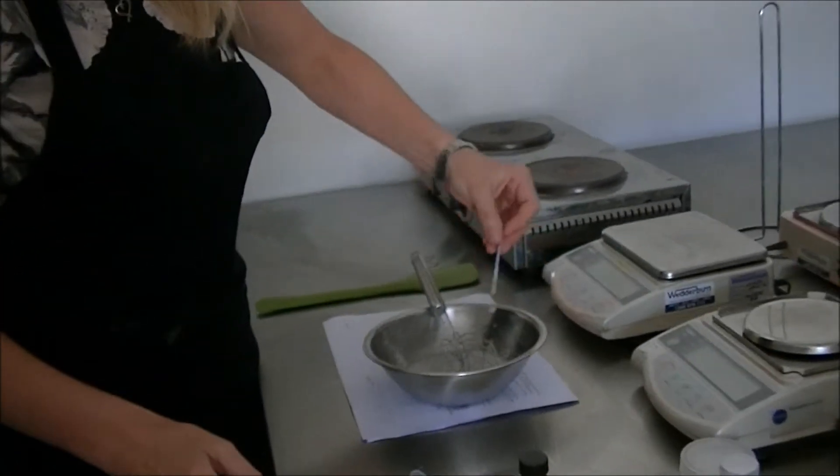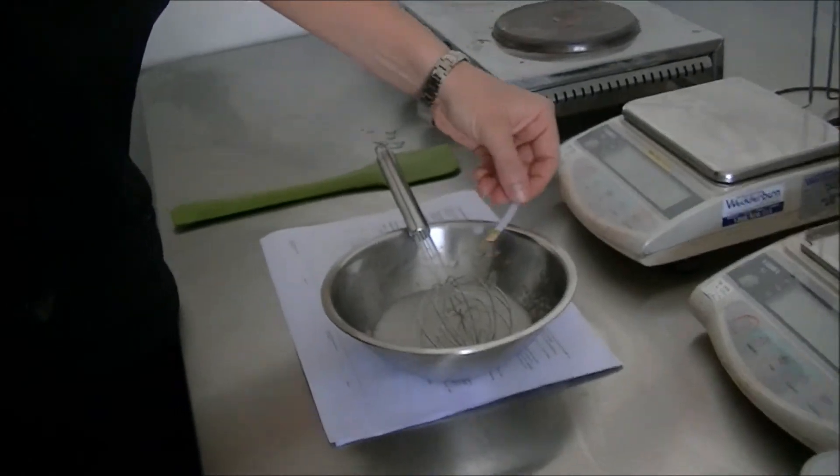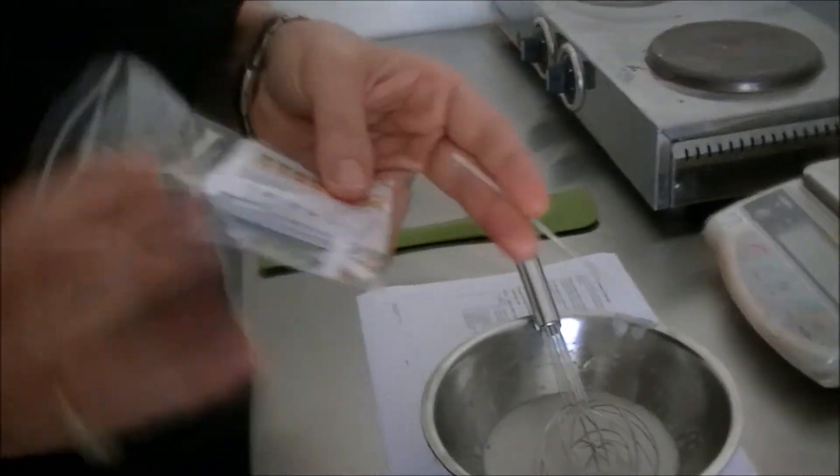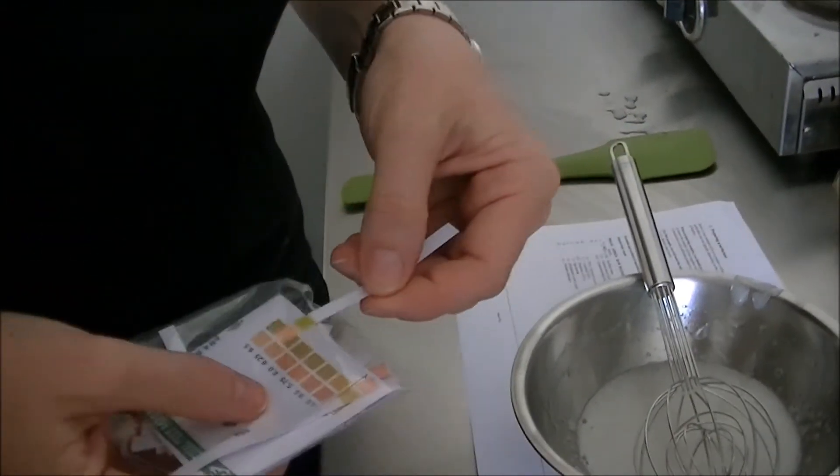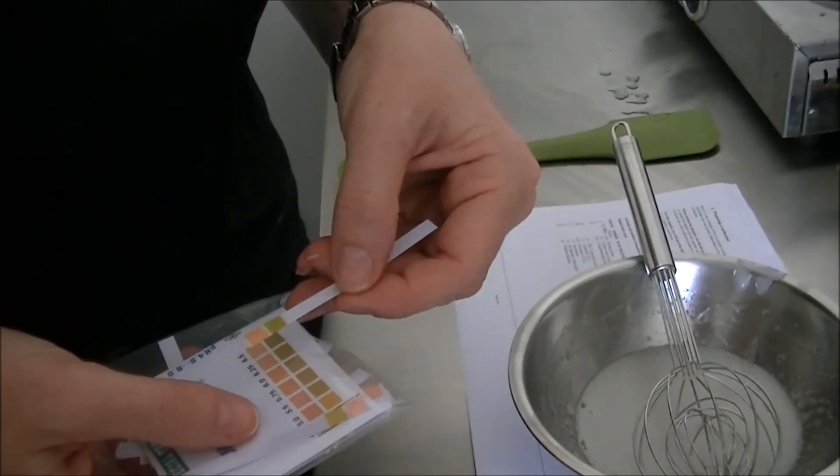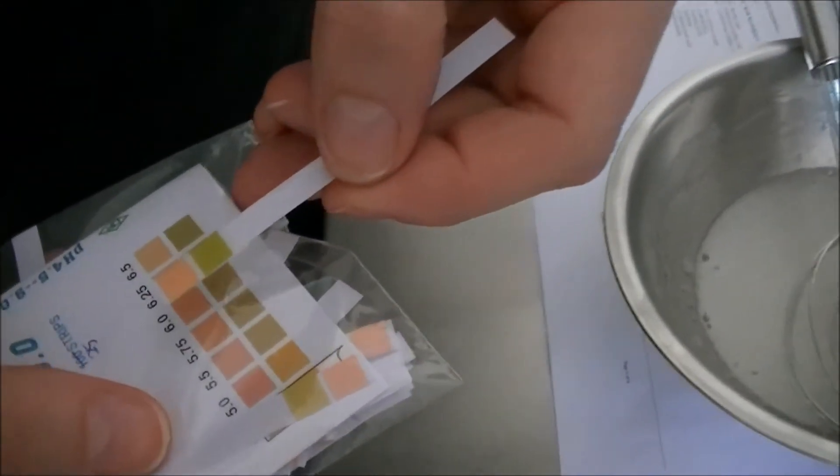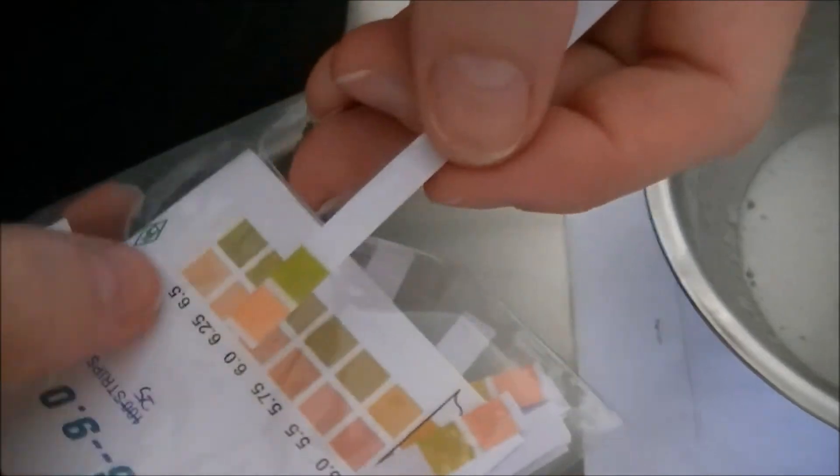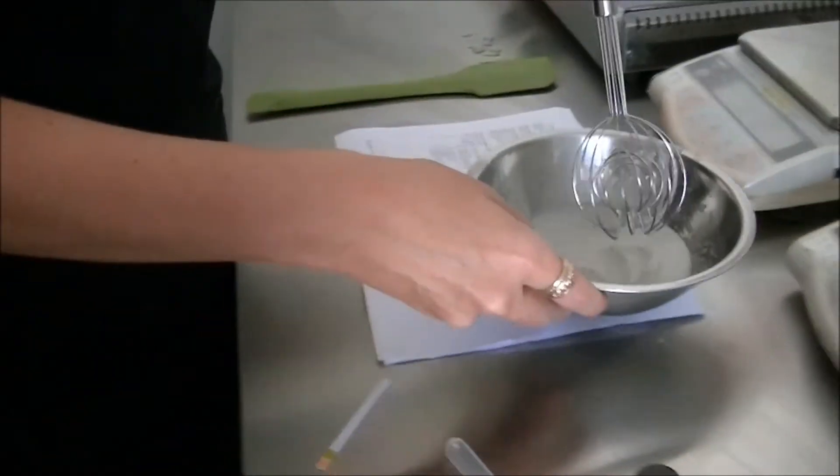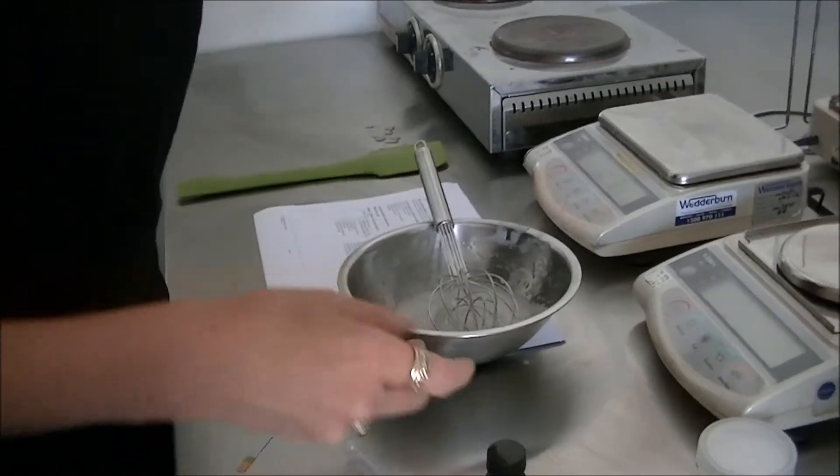So we dip it in. And we have a look. pH is definitely too high. So we need to take that pH down.